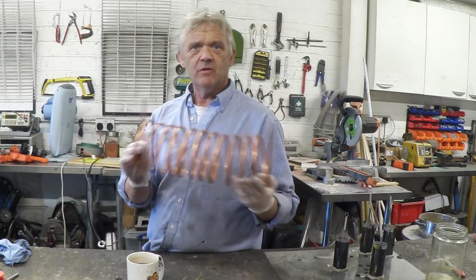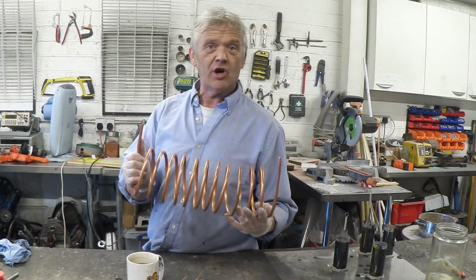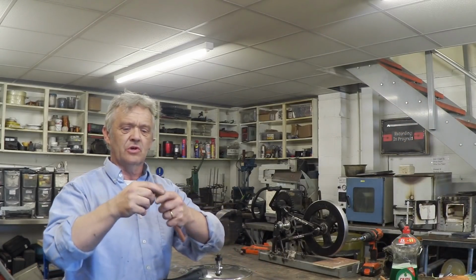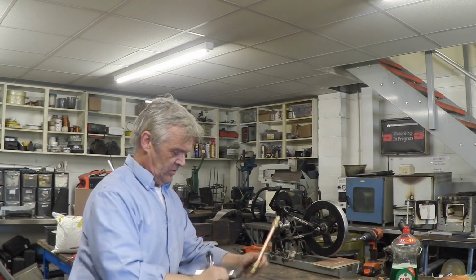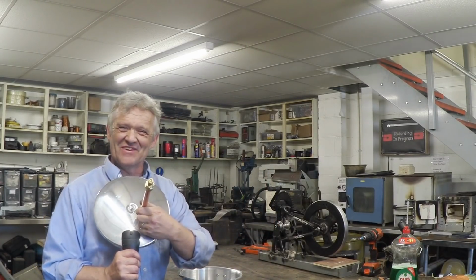With this being a standard fitting, we can use some standard copper fittings and something like a pressure cooker. So to make our distiller, what we've got is the coil that we've made, and then a pressure cooker, and this is an aluminium pressure cooker. You can buy them in aluminium or stainless steel. If you're going to do something a bit more caustic, use stainless steel. And then we've got a couple of fittings right here. That goes on the end of the coil and turns into 15 mil, which goes on there. That's another 15 mil, which goes on there. And then we drill out this lid, and that tank connector goes on the lid. And I've just dropped the weight. Anyway, let me drill the lid out.